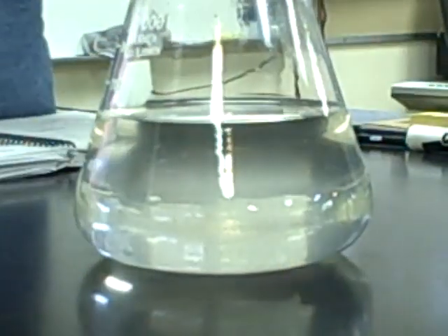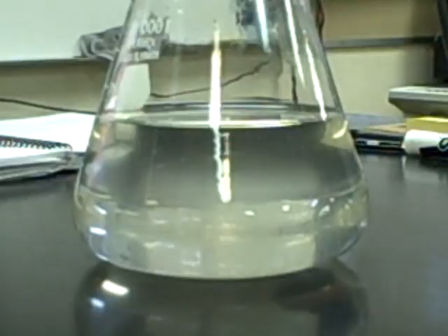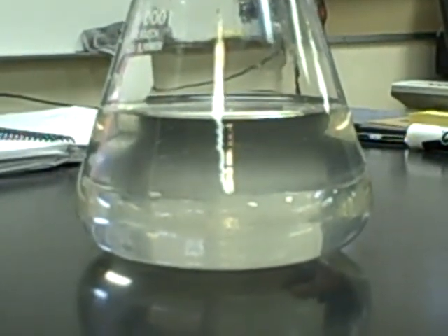So we have a supersaturated solution. There's more that can normally be dissolved in there at room temperature. It's very unstable.